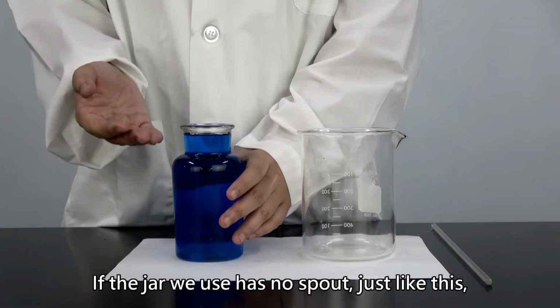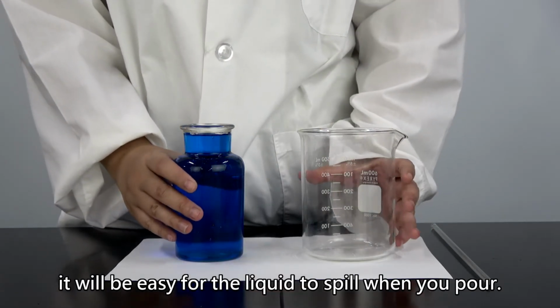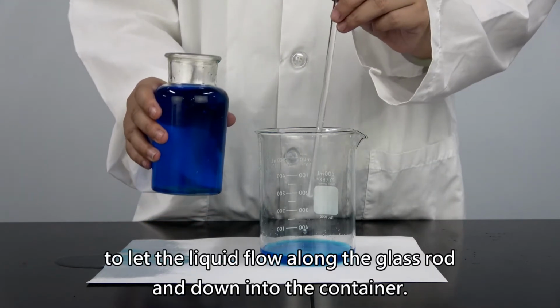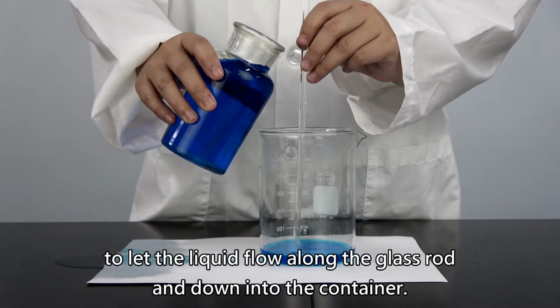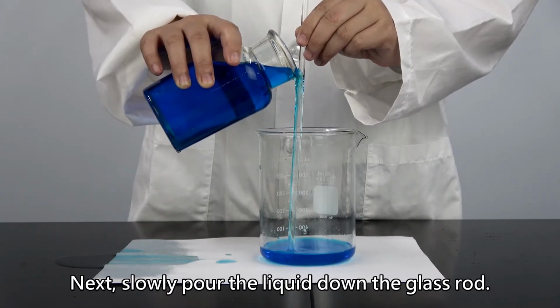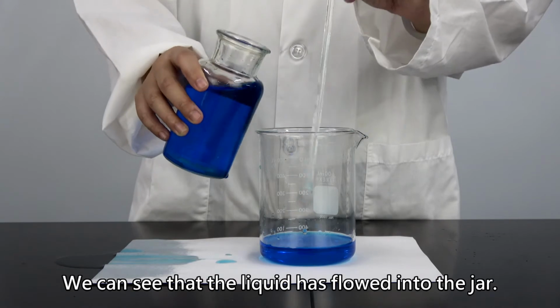If the jar we use has no spout, just like this, it will be easy for the liquid to spill when you pour. In this kind of situation, use a glass rod to let the liquid flow along the glass rod and down into the container. First, put the glass rod inside the container. Next, slowly pour the liquid down the glass rod. We can see that the liquid has flowed into the jar.